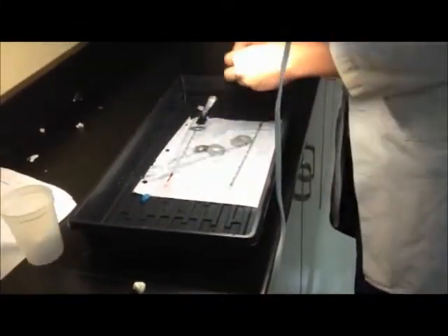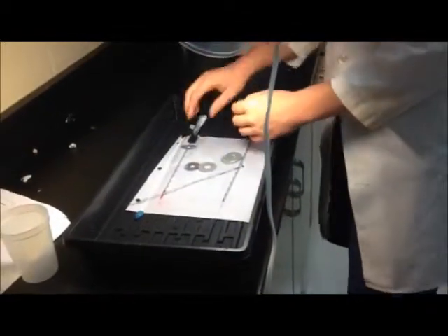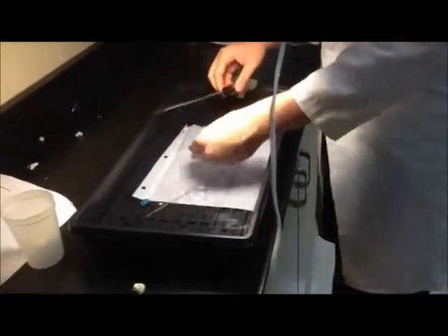After all the data is collected, clean up all of the parts of the experiment, making sure to be careful with the glass and the potassium hydroxide which can be caustic and damaging to skin.